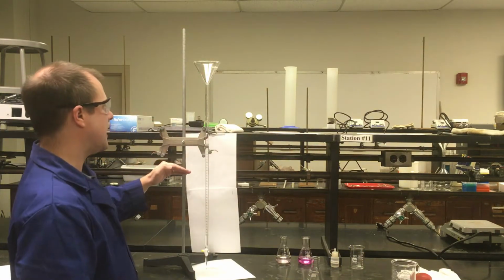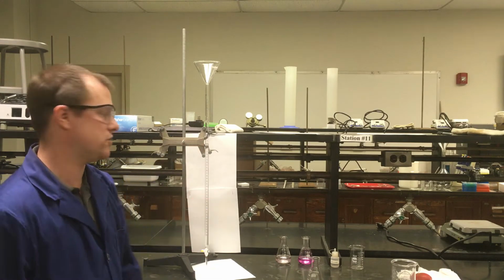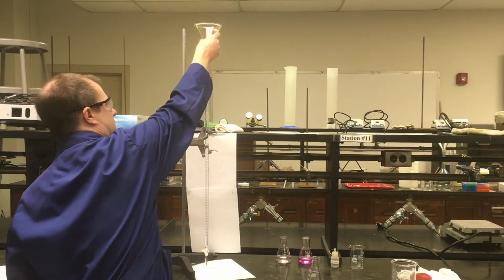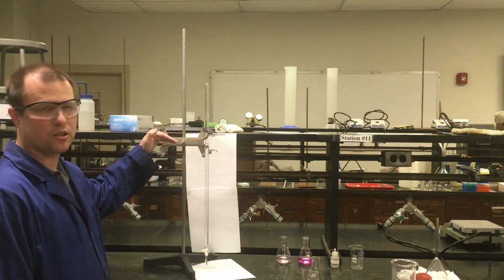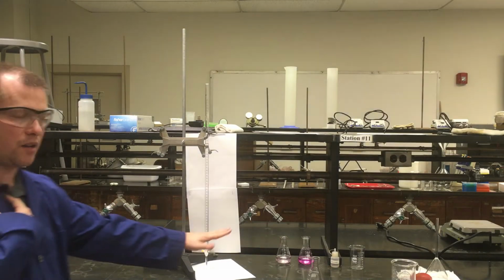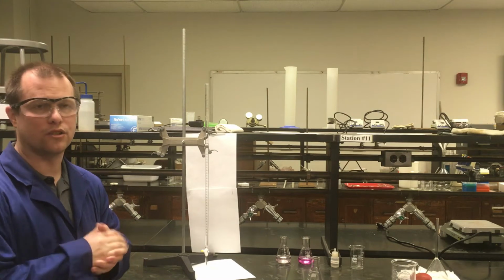So notice I didn't fill my liquid level all the way up to the top. My liquid level is actually sitting down here a little bit past 16, and I'll make note of what that measurement is here in a moment. But what I'm now going to aim for, now that I've added my base, I just want to make sure I record this number of where I'm starting, and then I'm going to record again of where I'm ending. And the important thing is I have a little bit of foreknowledge here because I've already done a couple trials. I know that for this experiment, it's going to take somewhere in the ballpark of like 24 or 25 milliliters to do this reaction.